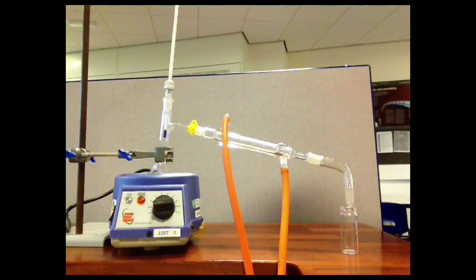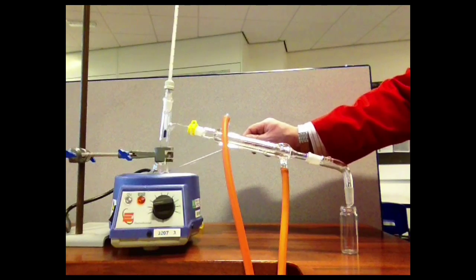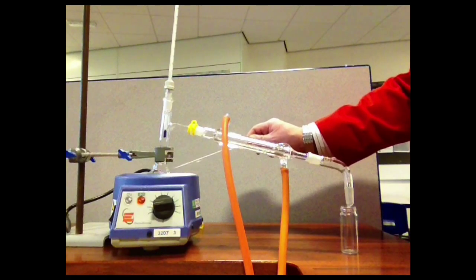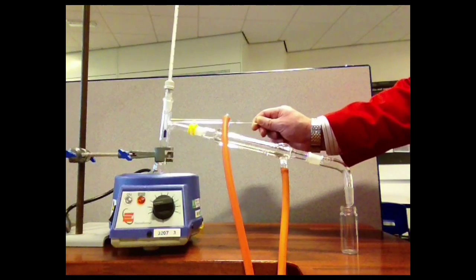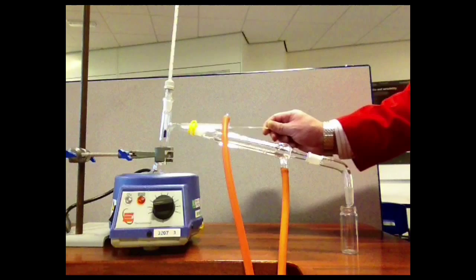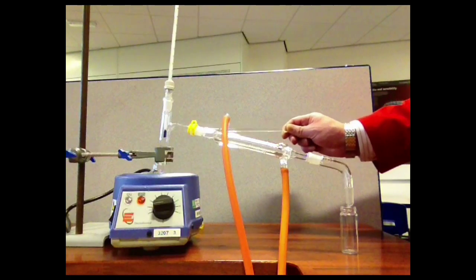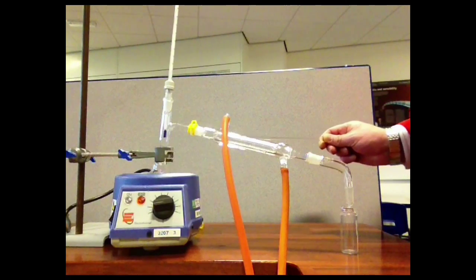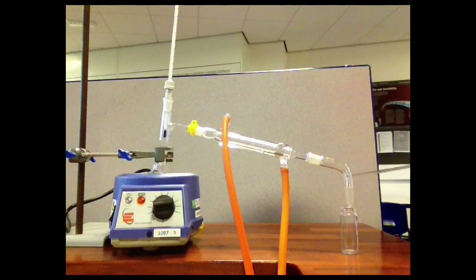So just to recap, the liquid in the flask here will be heated and boiled. When it reaches the boiling point of whatever liquid present has the lowest boiling point, that'll vaporize, turn into a vapor, and travel up into the condenser. We can read the temperature of the vapor to check the boiling point of the liquid we're collecting. The vapor will pass into the condenser, where the water-cooled jacket will turn it back into a liquid, and it'll travel down and be collected in the little collection vessel at the end.